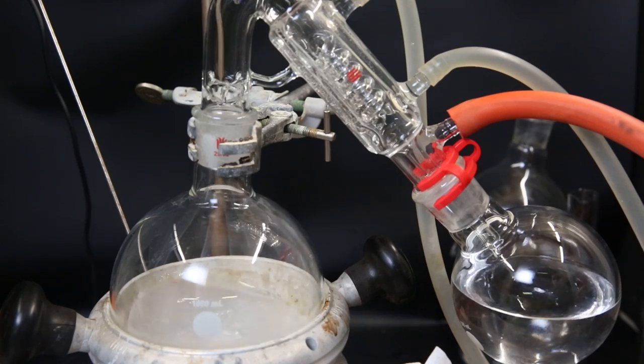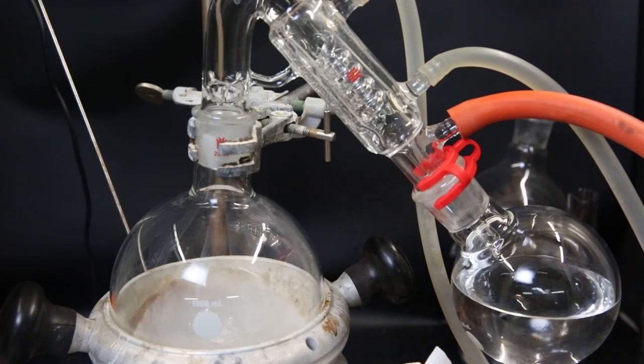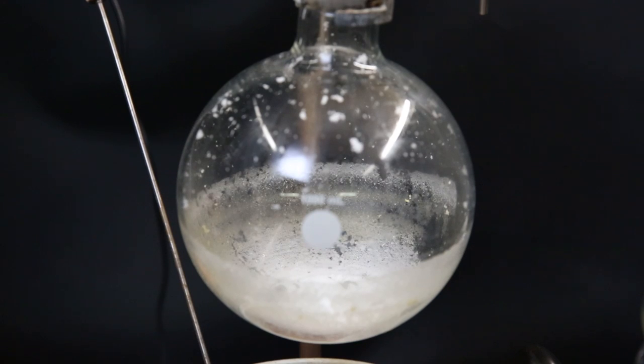In the meantime, I already started vacuum distilling over the liters of solvent. During the distillation, we can see the poor solubility with our own eyes. Even with hundreds of mils of solvent remaining, the product already precipitates as a white solid. After boiling off all of the solvent, the flask is coated in a white fluffy solid. But because the column ran for so long, some yellow impurity also came through.